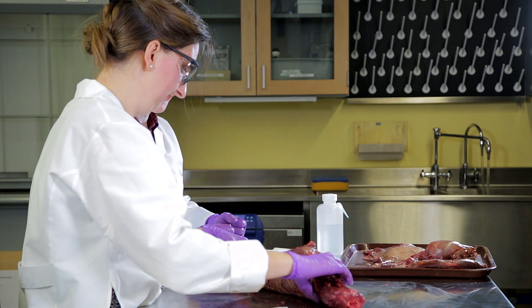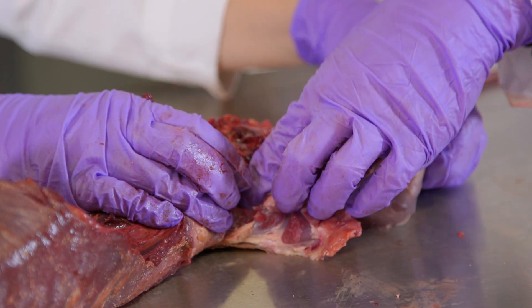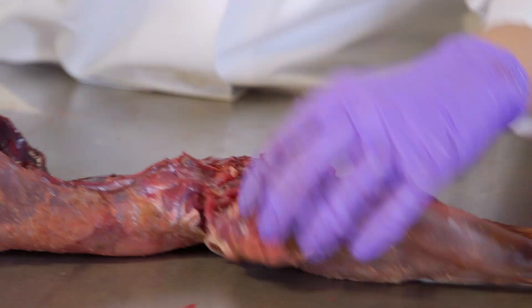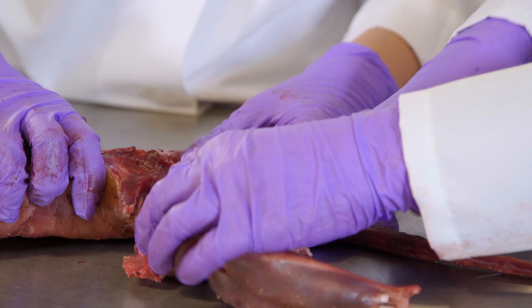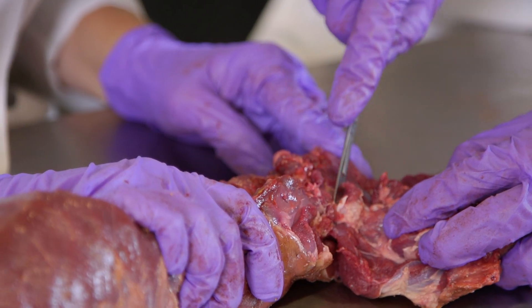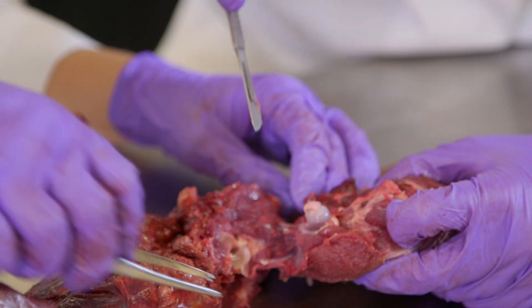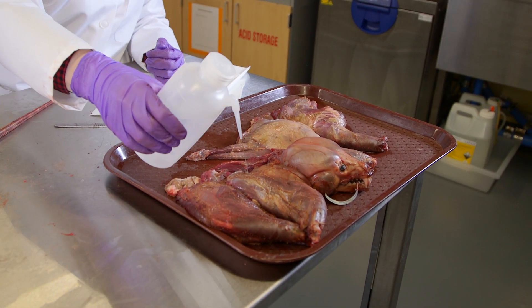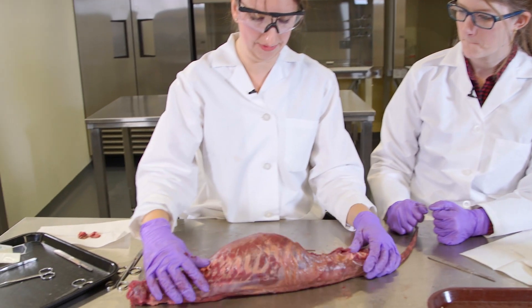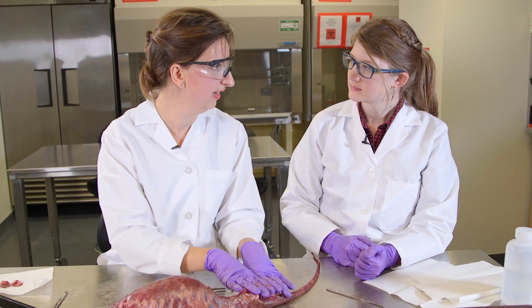Want to have a try with the other limb? You can feel the bones — if you wiggle, you can feel the joint. Open up the joint capsule, feel where it is, cut where you felt the joint moving, just keep cutting around, cut through the ligament, and the leg is off. Make sure we're hydrating those legs. What we have left now is the vertebral column, the pelvis, and the ribs. Before we do our experiments, we'll also remove the pelvis and the ribs.